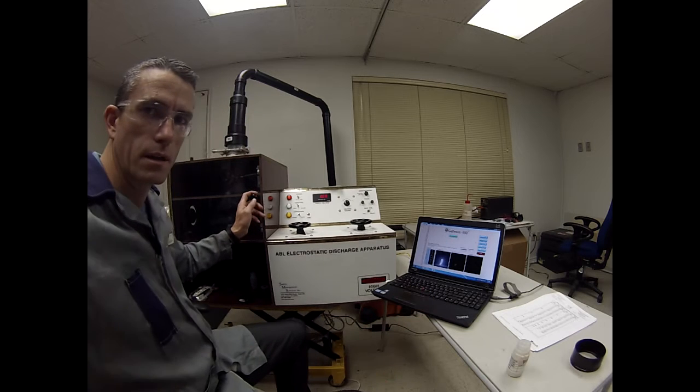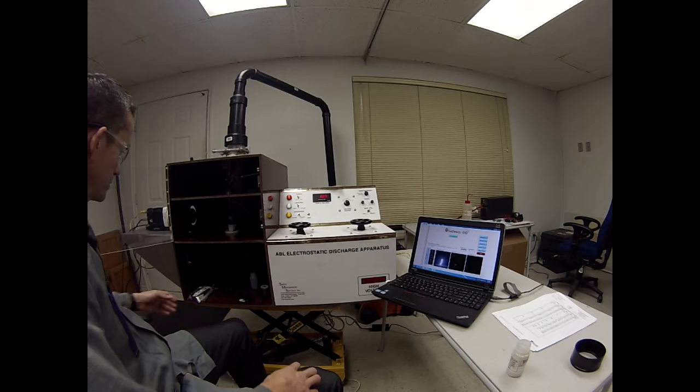Okay, now we'll collect some shots with PETN.